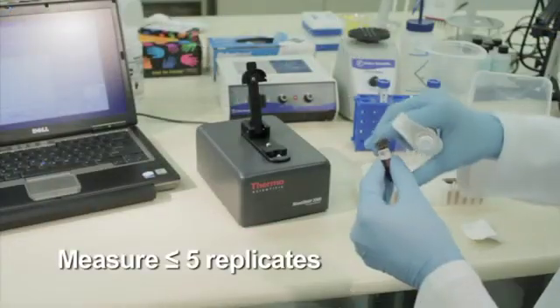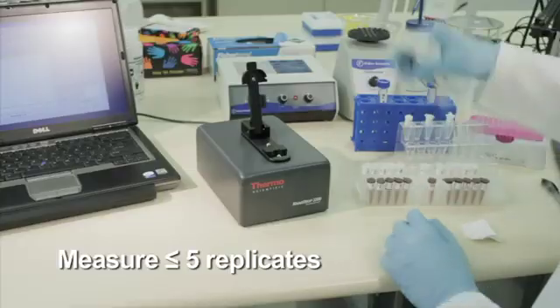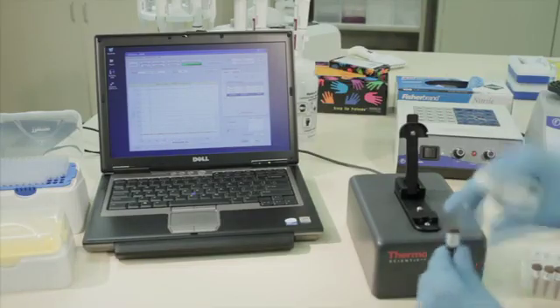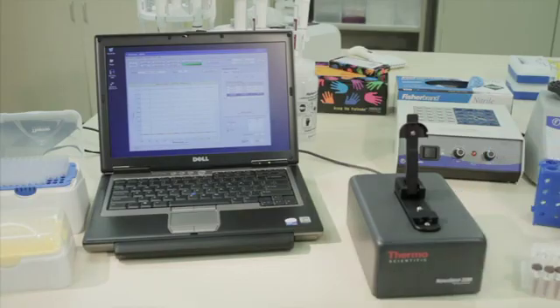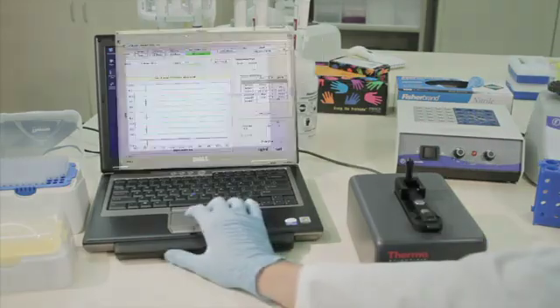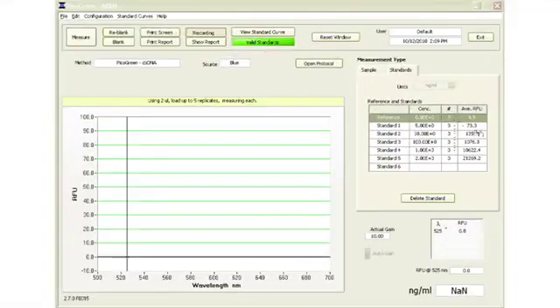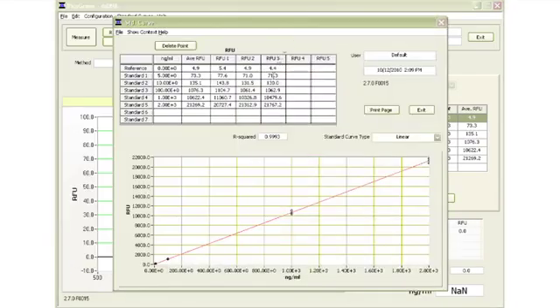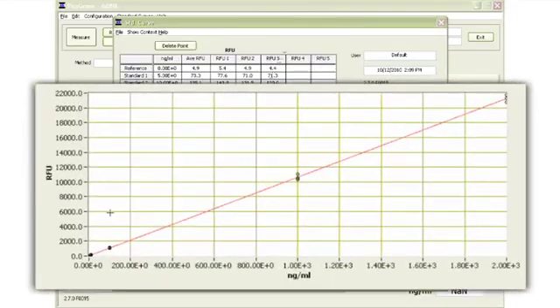Measure up to 5 replicates of the reference using a fresh aliquot for each replicate. Repeat the process for the additional standards to build a standard curve. Up to 7 standards may be used. The software is designed to store up to 5 replicates for each standard. Replicates of the standards are averaged to generate a standard curve from which the sample concentrations are automatically determined.